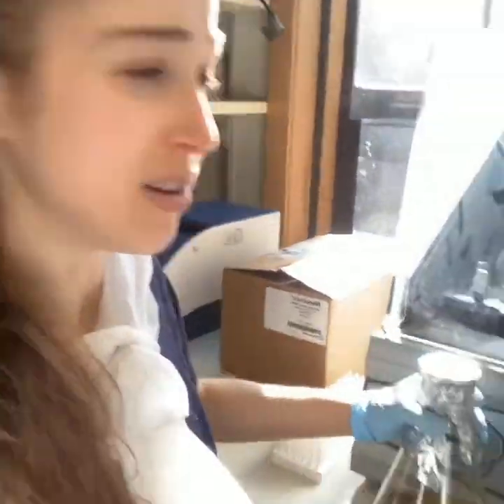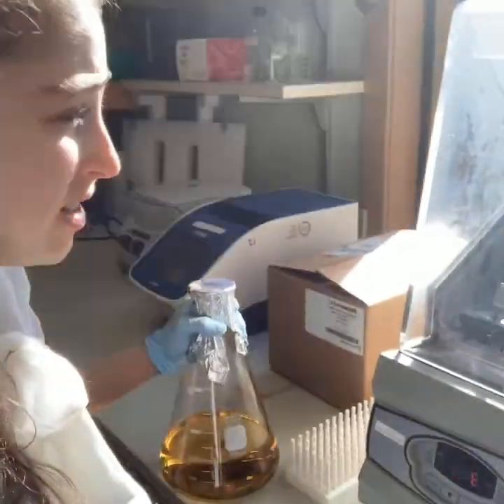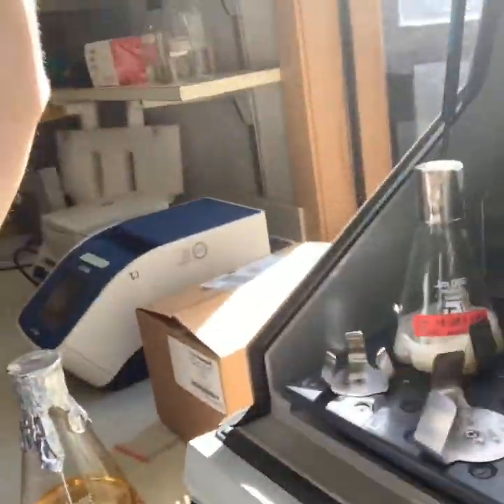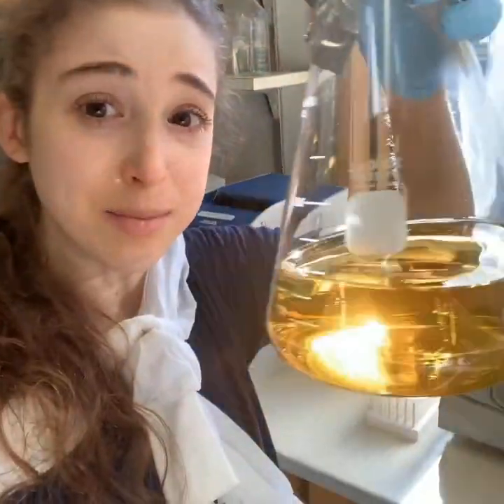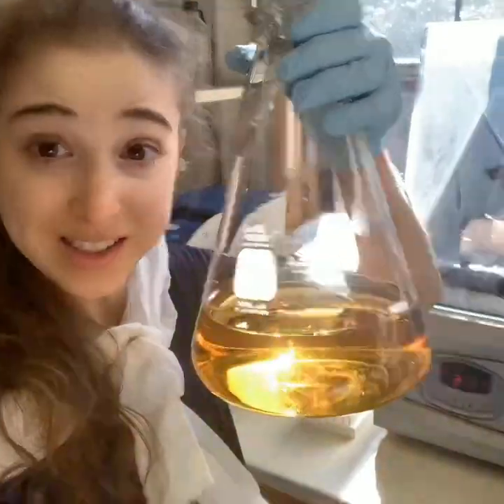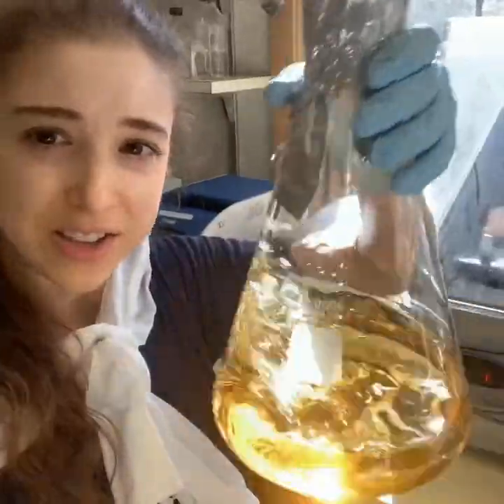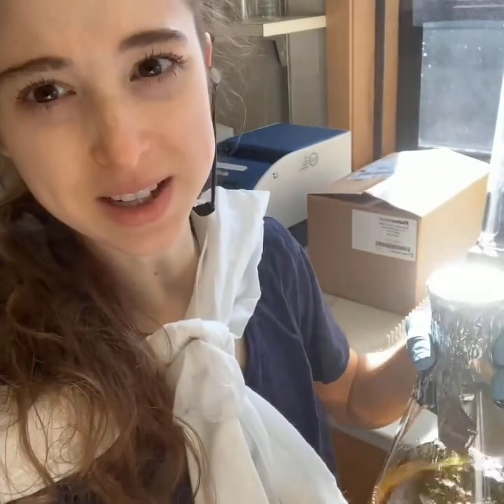Right now what you'll see — in this shaker incubator — this is a starter culture. It's just a small flask and you're letting the bacteria grow enough, and then I'm going to stick it in bigger flasks like this in a bigger shaker incubator and let the bacteria grow and grow and make the protein.